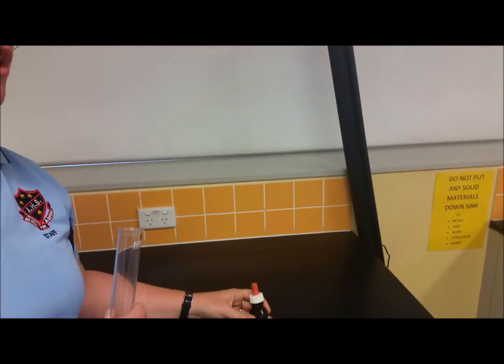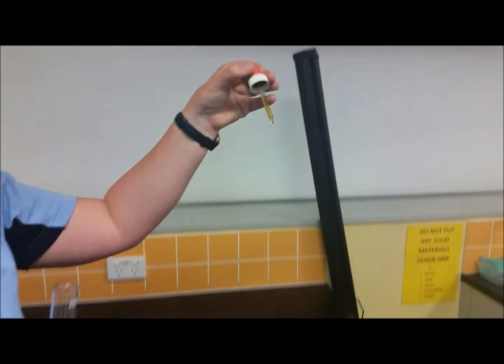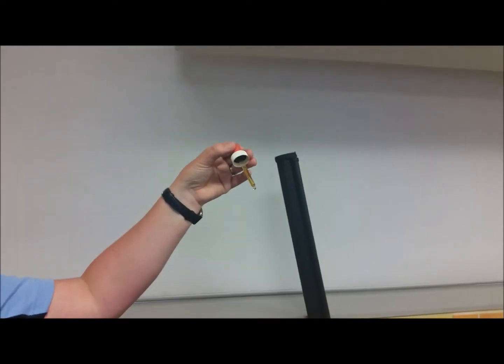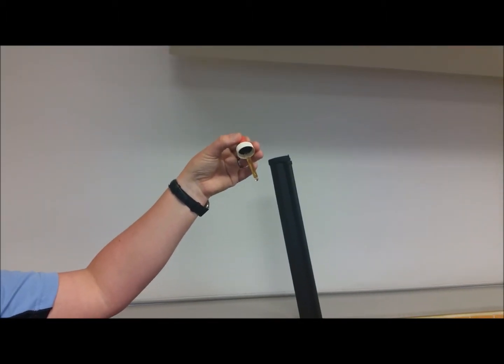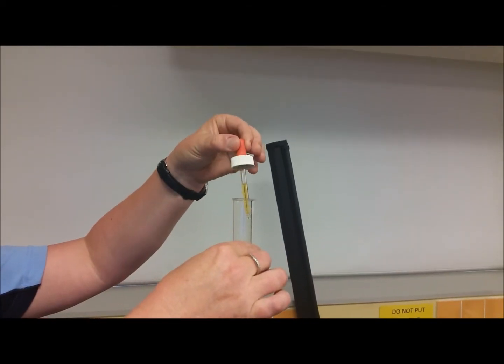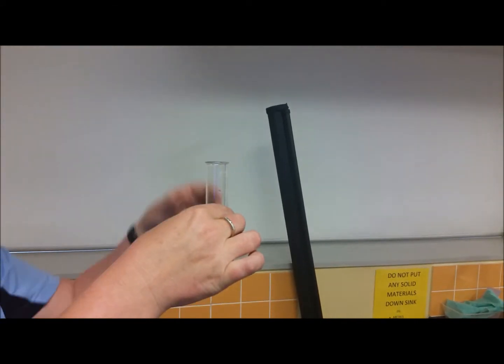Similar to the Benedict's with the glucose, I want you to take one pipette full of iodine and you add it to, in your case to the food, I'm going to add it to the starch. Okay.